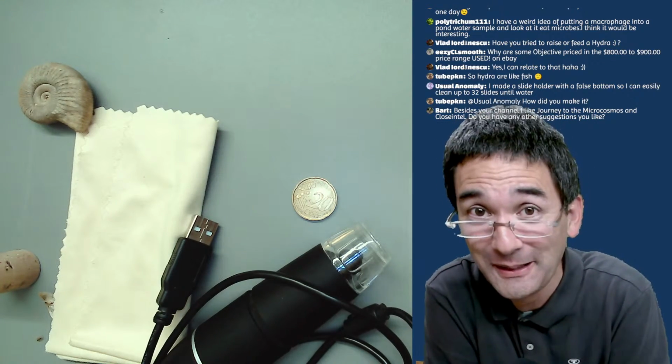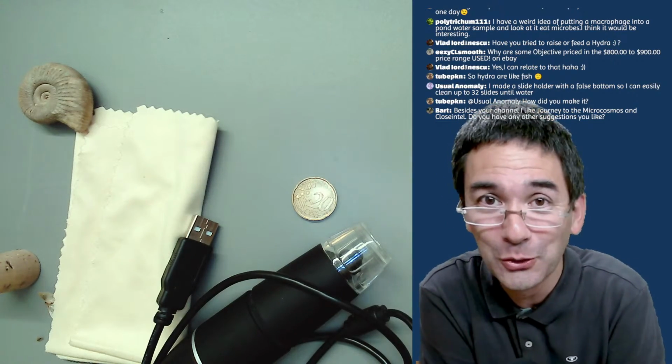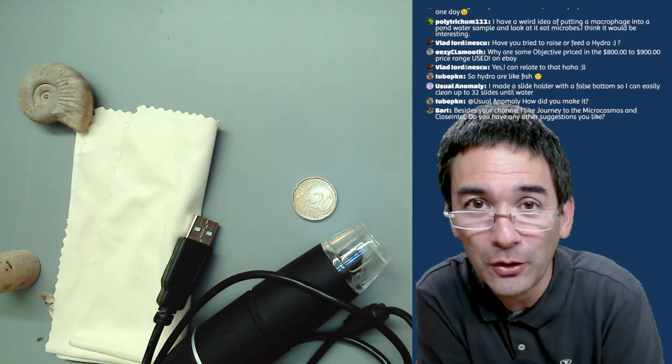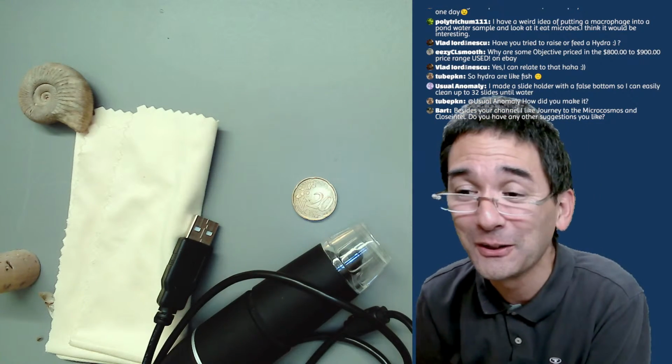I 3D printed it, and the consequence was that the rack came out all bent and crooked because, of course, of the heat of the dishwasher, it was bent. Yeah, so unfortunately, it did not work.